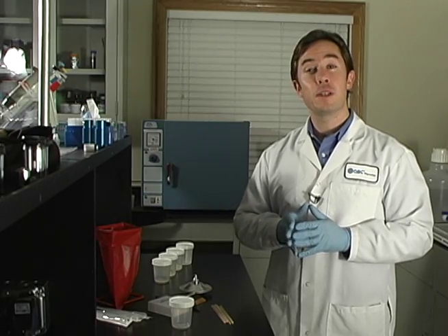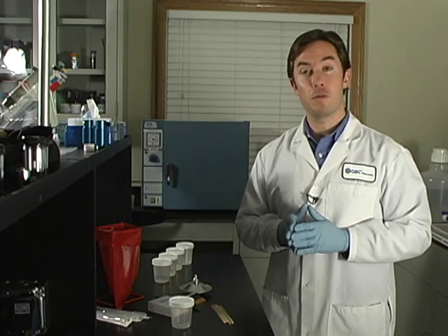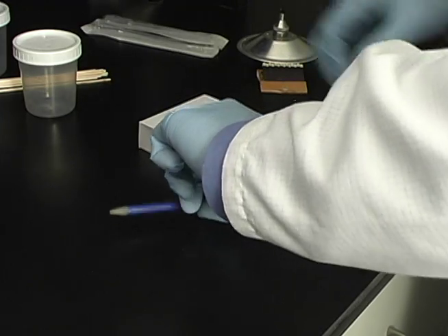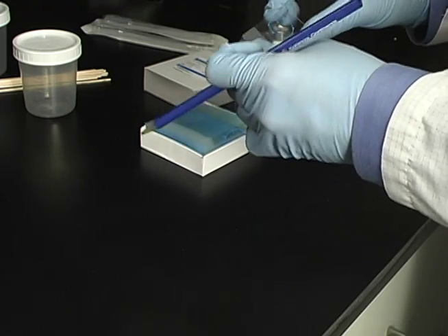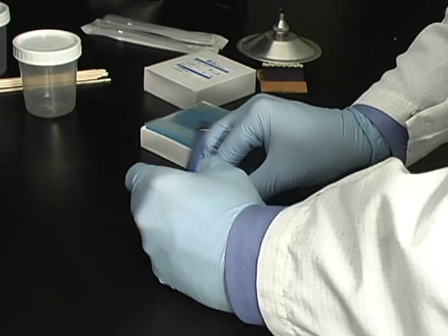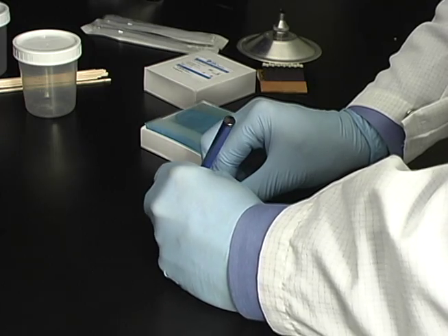Preparing a direct smear is a basic step in the laboratory detection of AFB. Prior to smear preparation, choose a new SureFocus slide that is clean and unscratched. Properly label the slide with the patient ID number, as dictated by your laboratory protocol.